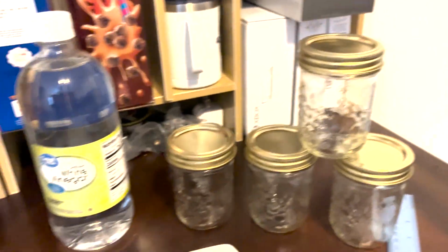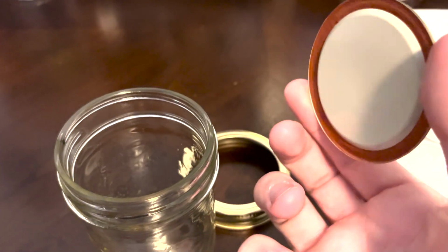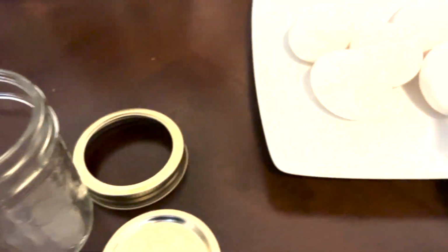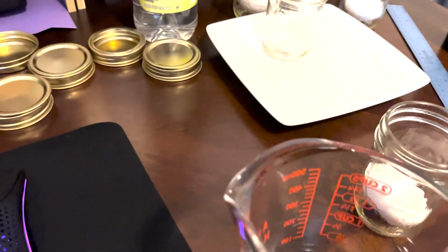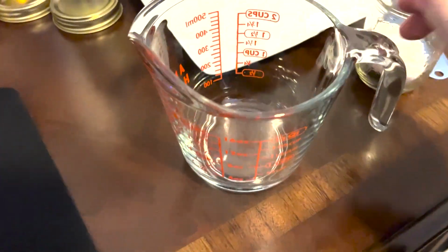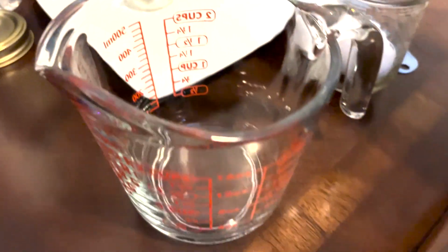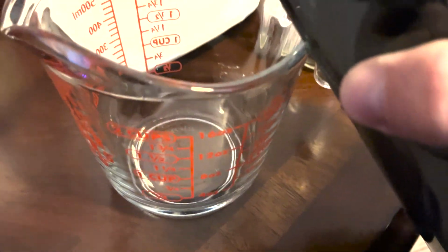Once you have all these materials, you're going to open each jar and you're going to place a raw egg inside each jar. And make sure to be careful while placing it inside, as the egg is very fragile. Next, on your jars, you're going to find a mark that you'll use as your fill line. If you don't have one, you can always draw one on. But with these jars, they had a mark on the lid that worked.